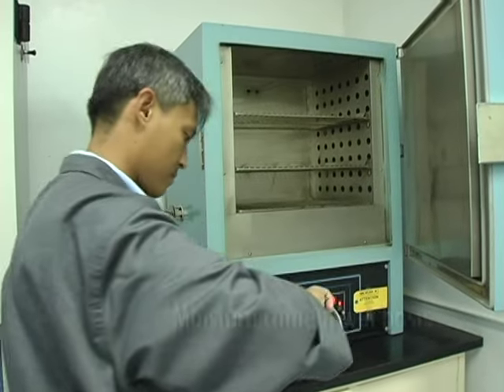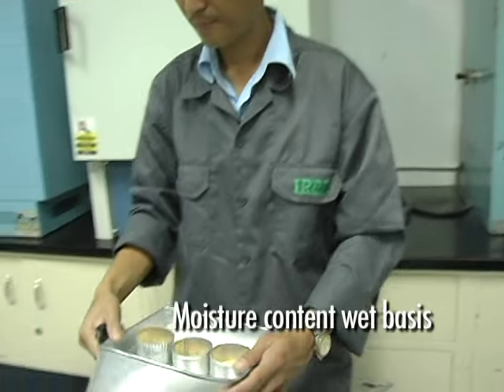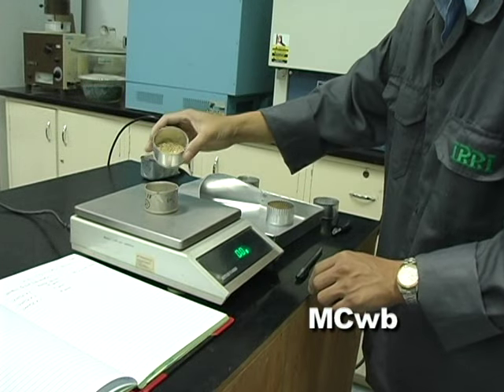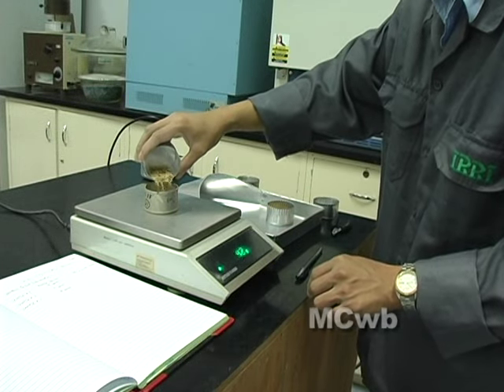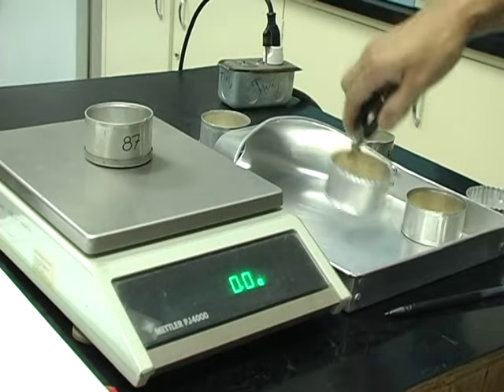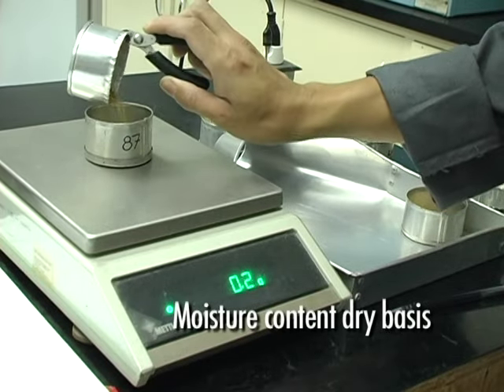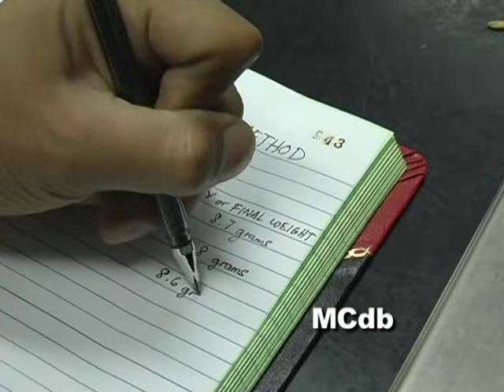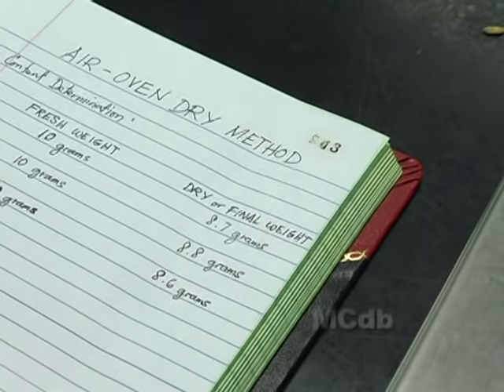Moisture content usually refers to the wet basis, which means the total weight of the grain including the water. Moisture content wet basis. For research, moisture content sometimes refers to the dry matter of the grain. Moisture content dry basis.